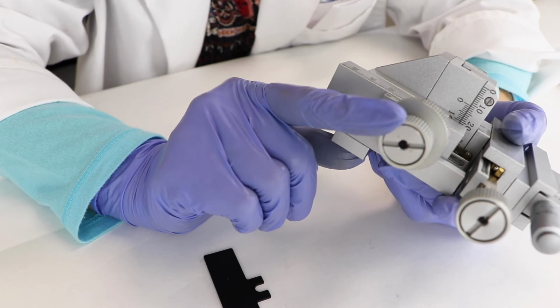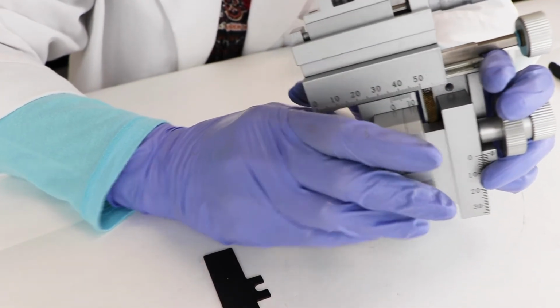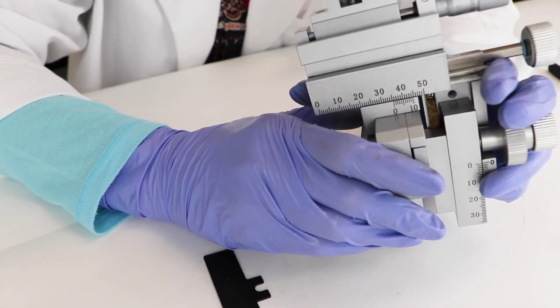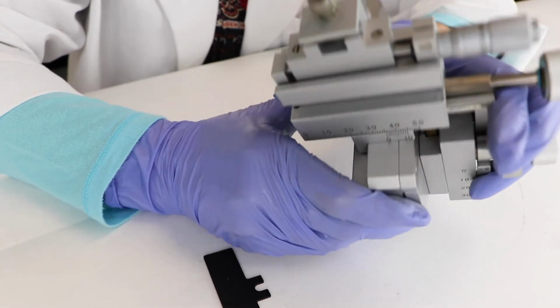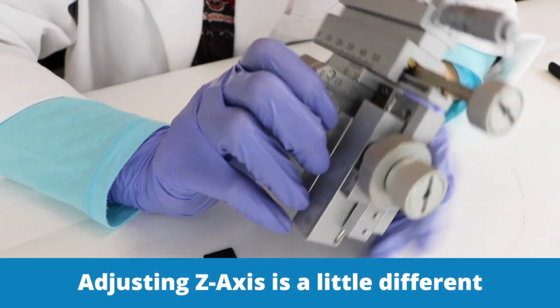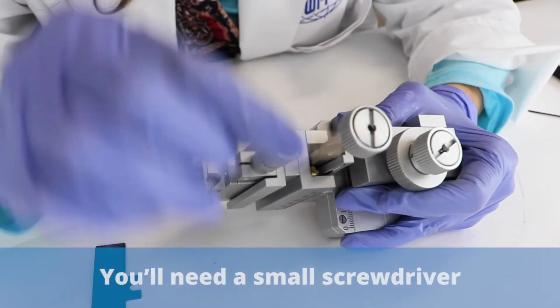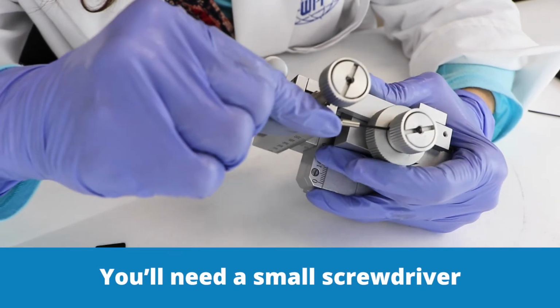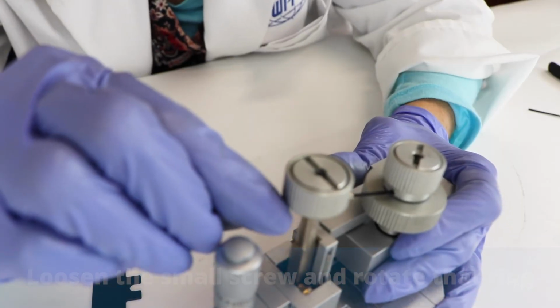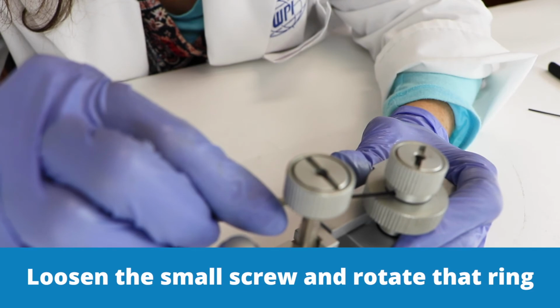It's the same control. If the manipulator is operated in the standard position with the electrode clamp located right above the manipulator body, then the y-axis doesn't typically drift as much unless it's tilted to the left or to the right. Adjusting the z-axis is a little bit different. You need a little tiny screwdriver, and that fits right down in here. And there's a tiny screw inside, and you're going to loosen that and rotate that ring to adjust the z-axis.